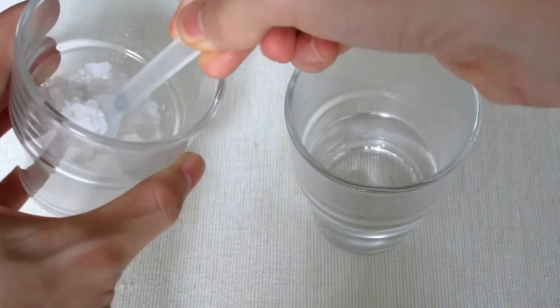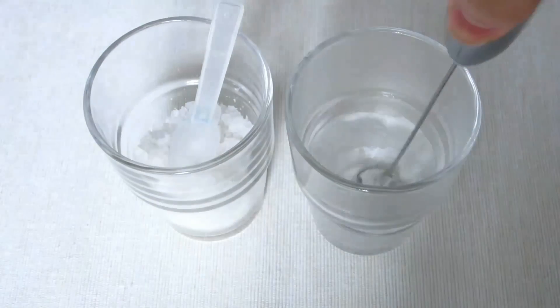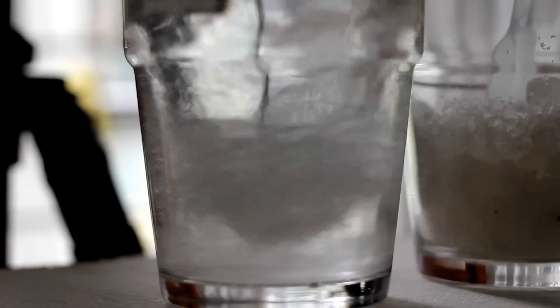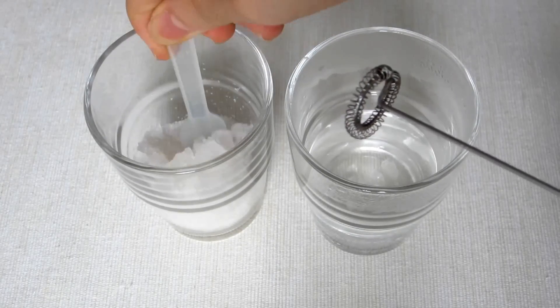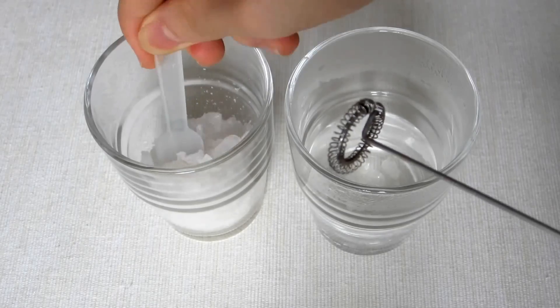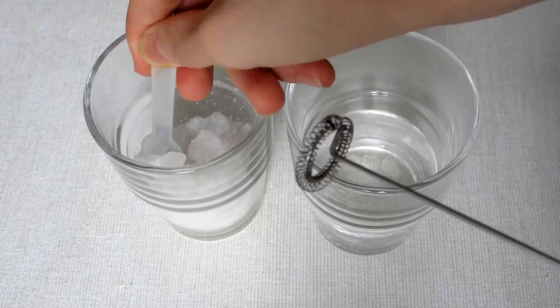Add a little amount of alum and stir it well until all alum is dissolved. Add some more alum and stir it until it stops dissolving. We are going to just enough saturate the water. To do it faster, you can use a stirrer.